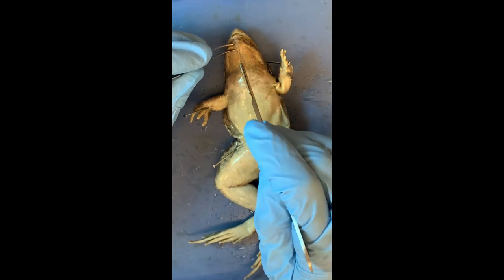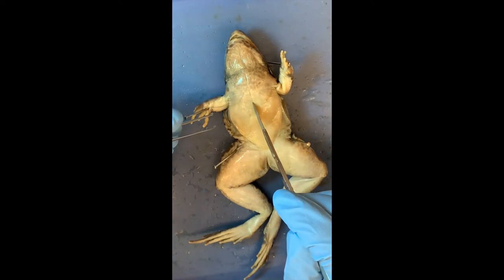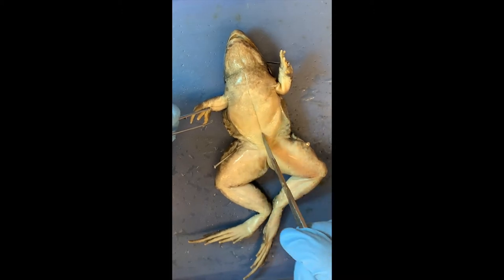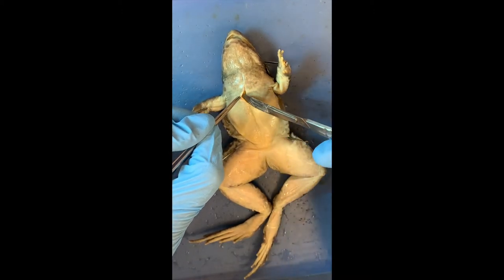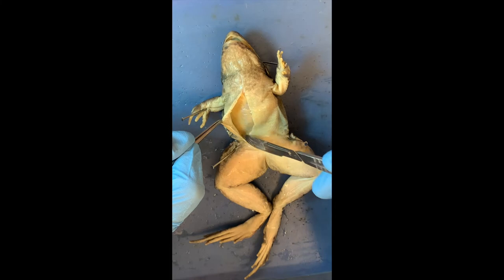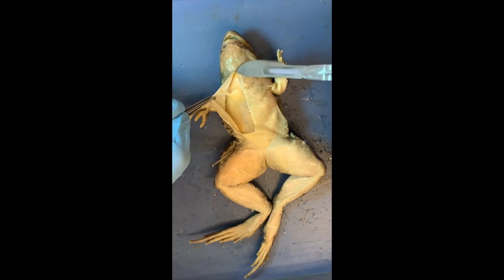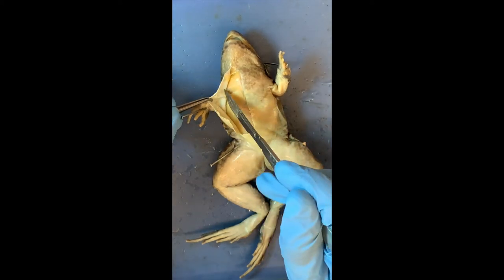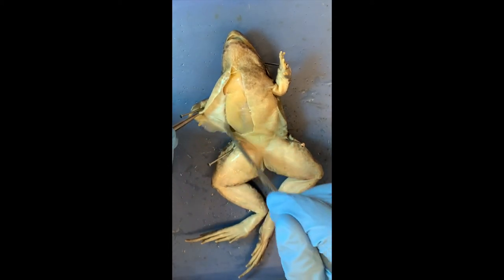I'm gently cutting the skin because I don't want to damage anything. Whenever you're doing dissections, you do not want to saw through your specimen or cut it like it's a steak. Just a nice, gentle, shallow set of cuts until the skin starts ripping and you can pull it back — because the internal organs and the body cavity, you don't want to break those. What do we see right under that skin? Muscles. They have muscles — that's what allows them to jump everywhere and move.